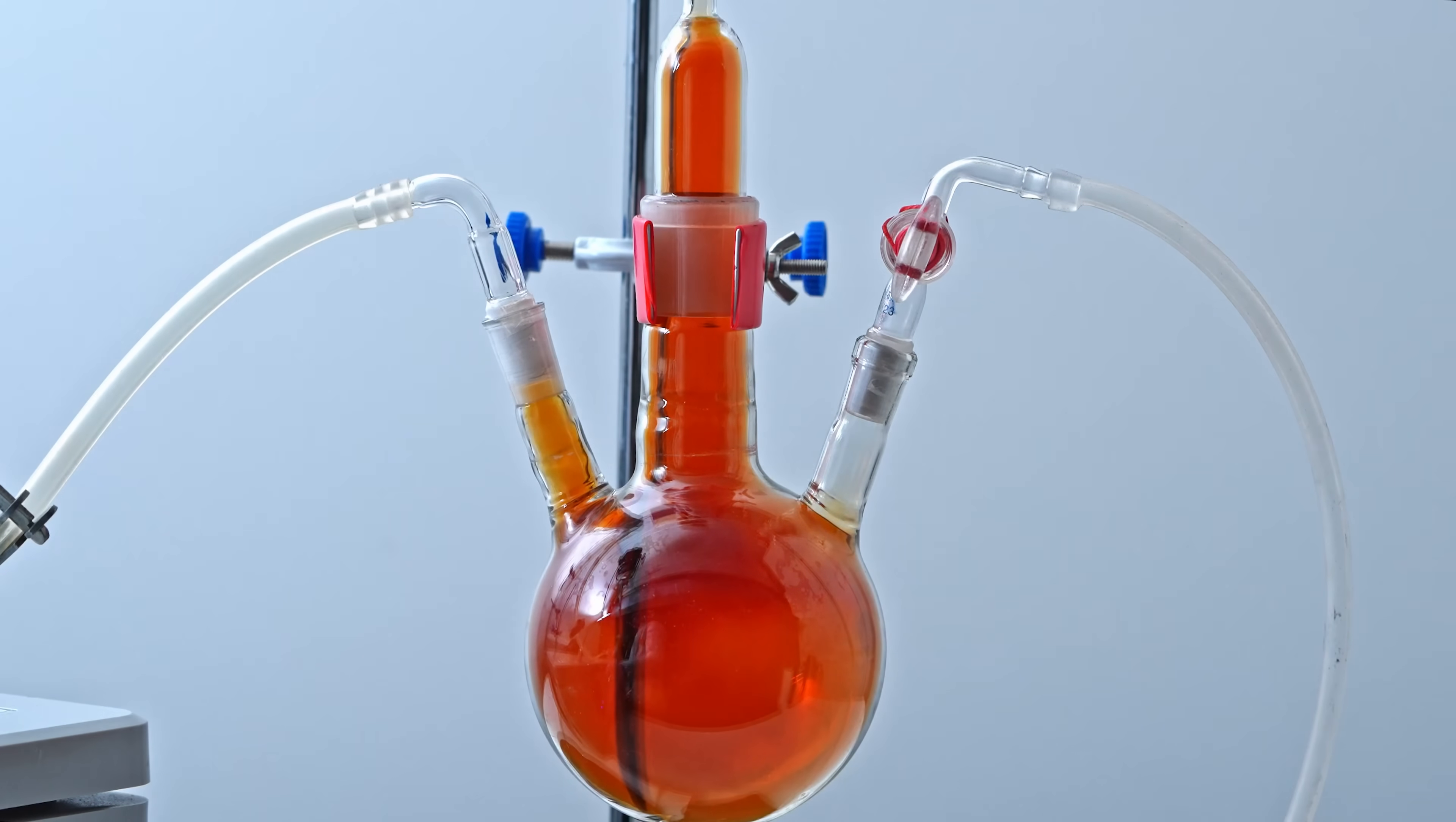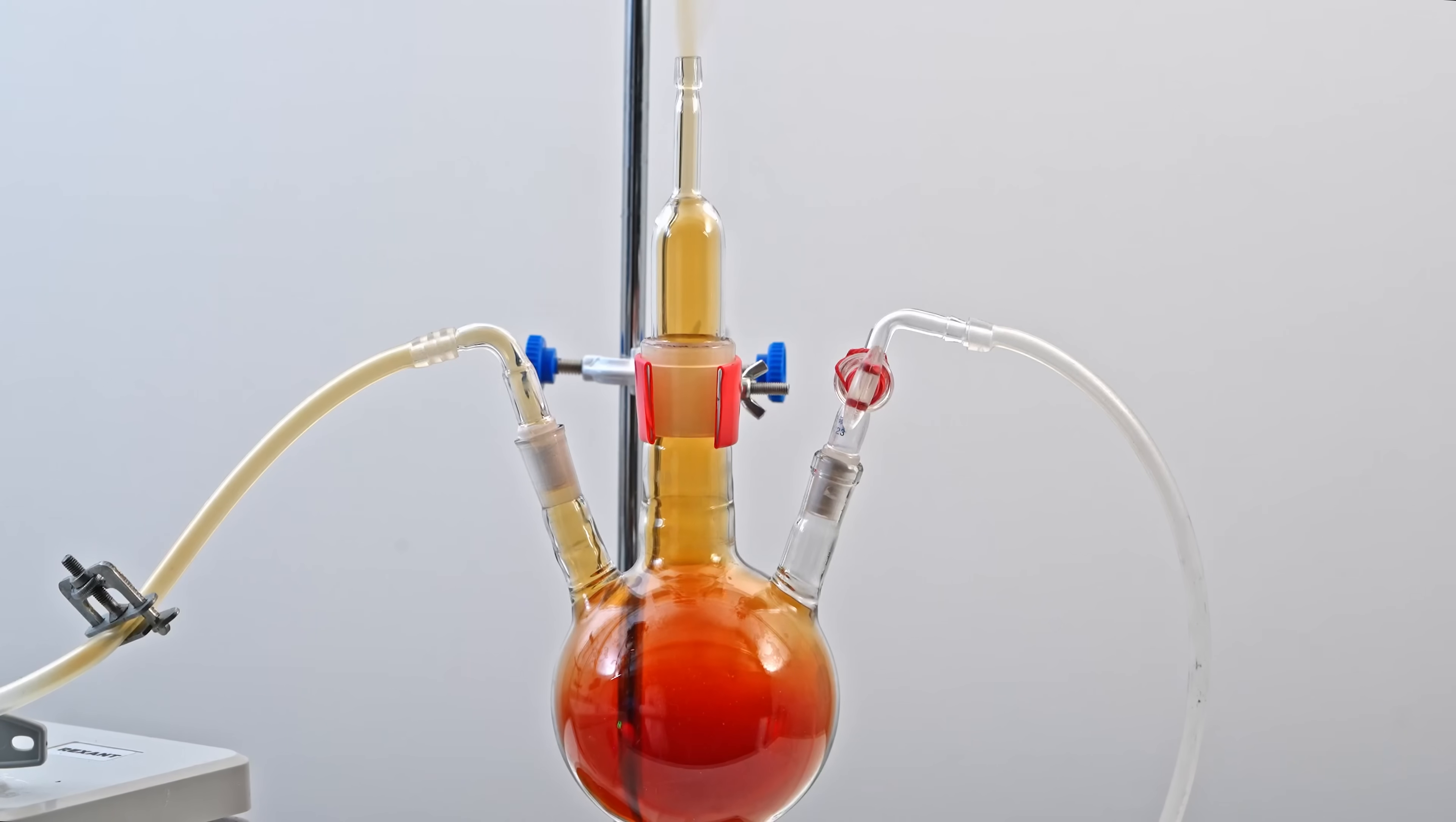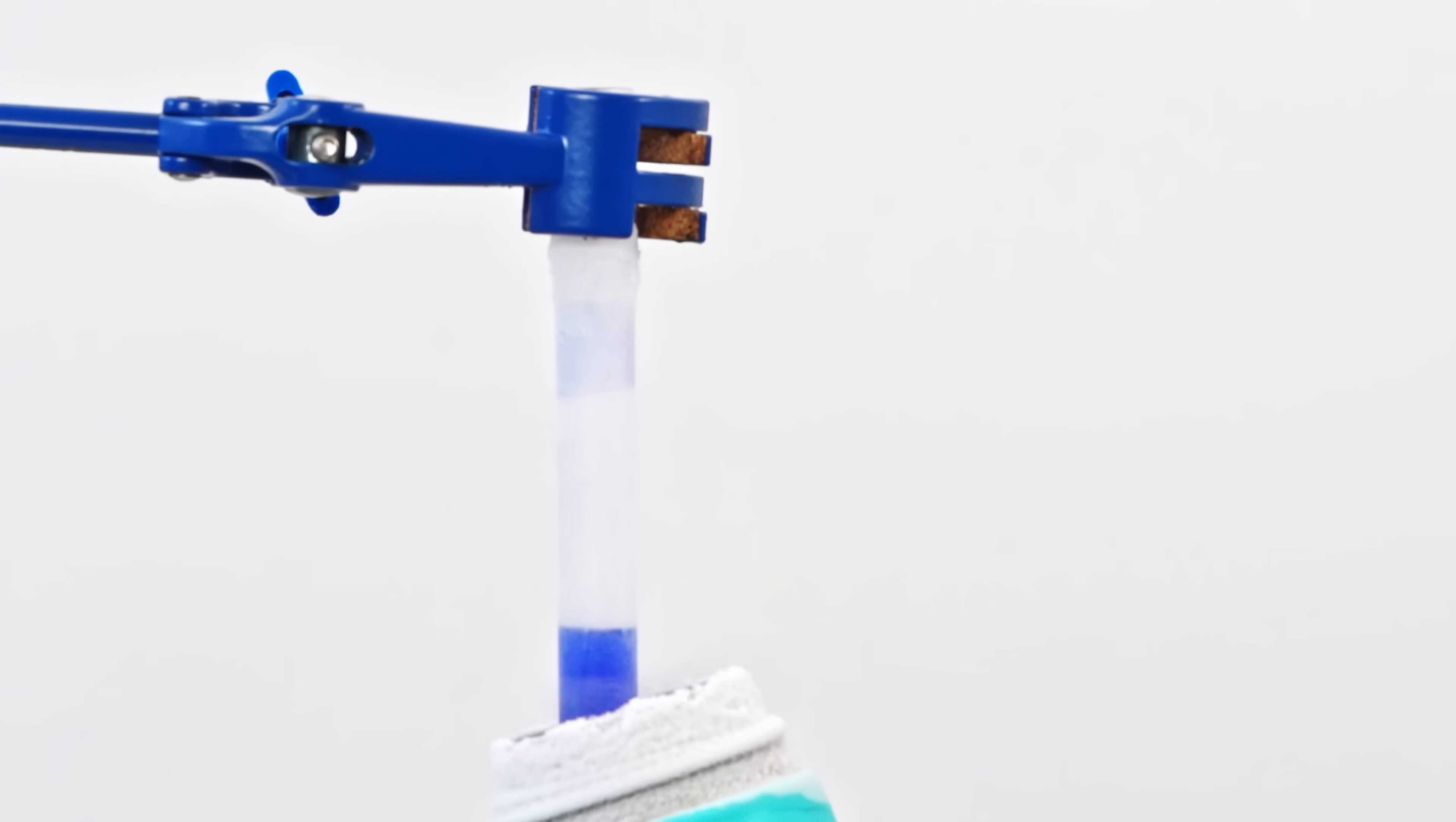The nitrogen monoxide reacted with ozonated oxygen to form reddish-brown nitrogen dioxide without any accompanying glow. I suspected the issue was insufficient ozone concentration, so I decided to prepare liquid ozonated oxygen. This liquefied gas has a much higher ozone concentration.